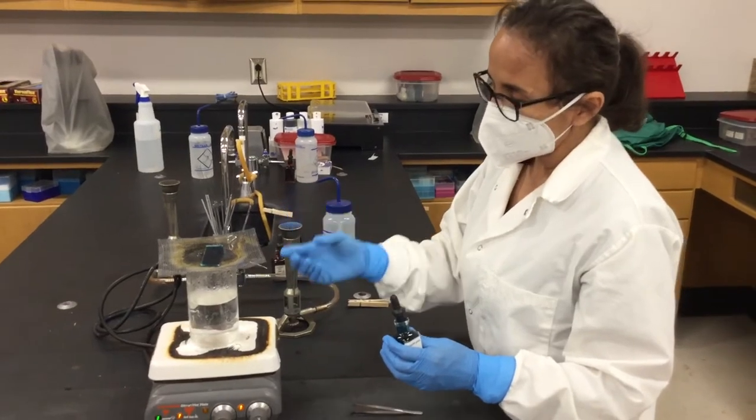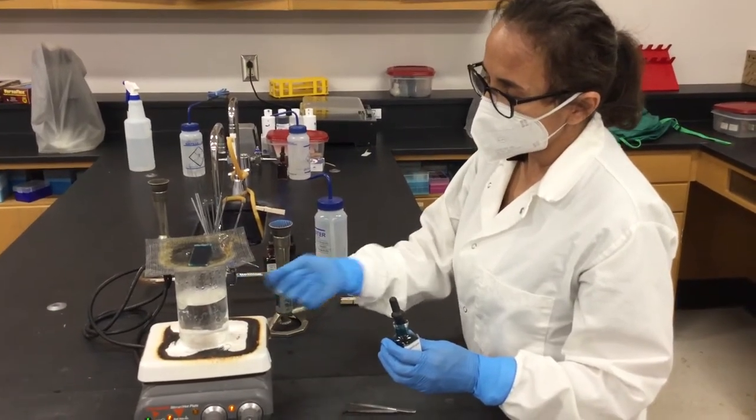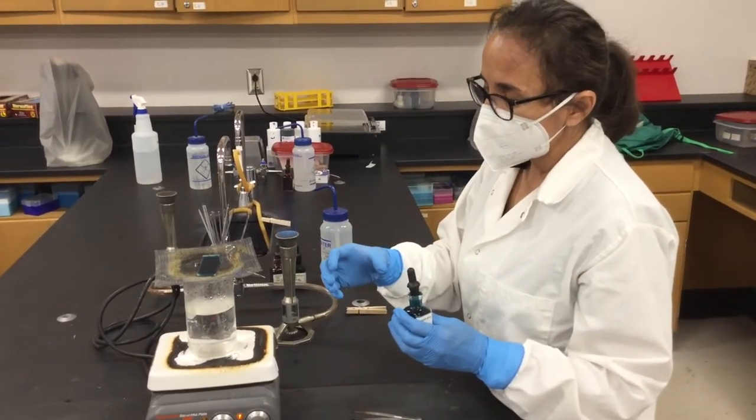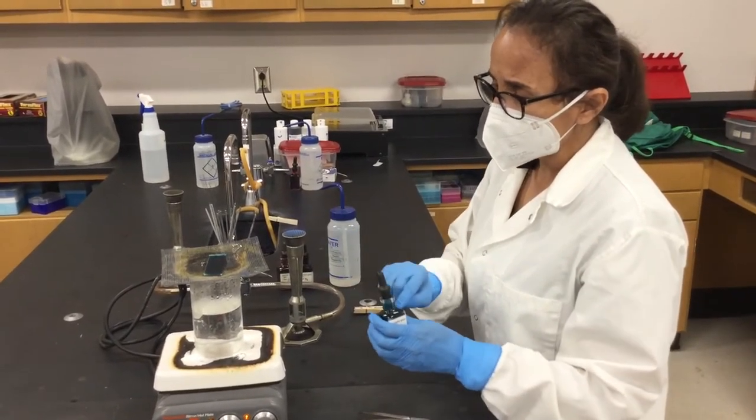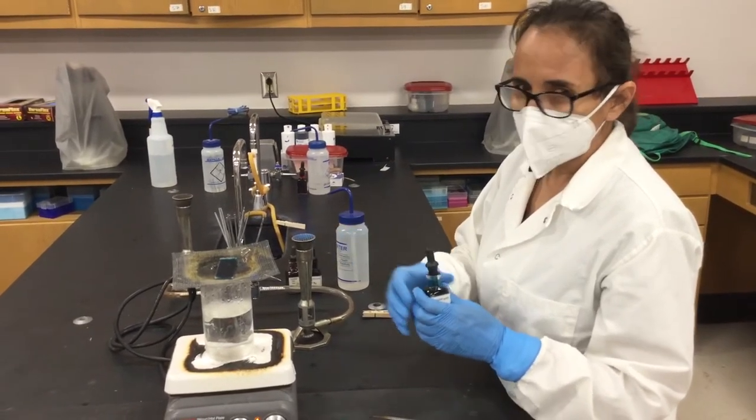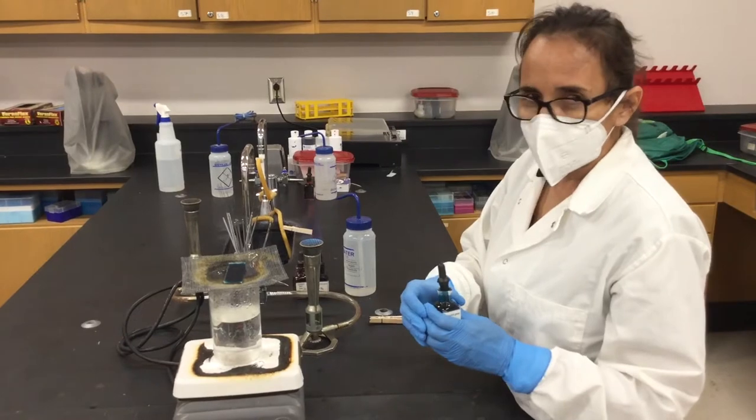And the purpose of putting vapor on the bottom of the glass slide is to open the walls of the endospore so that the malachite green, which is the primary stain for endospore, will penetrate and stain the internal part of this endospore.